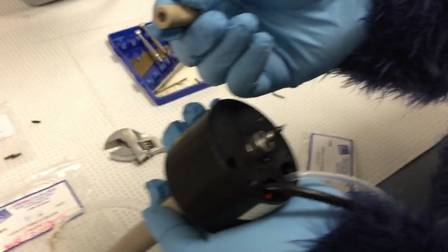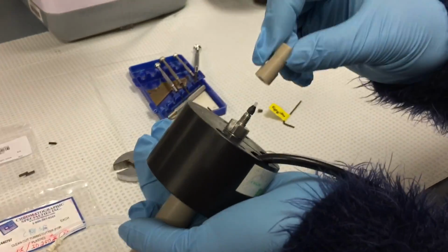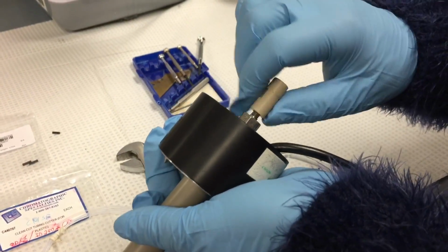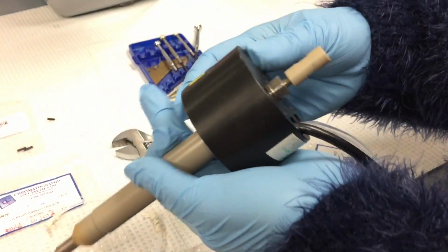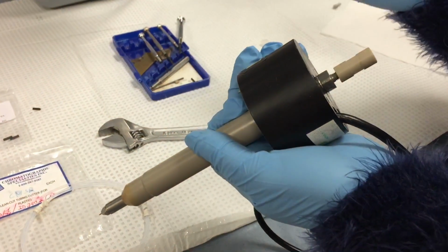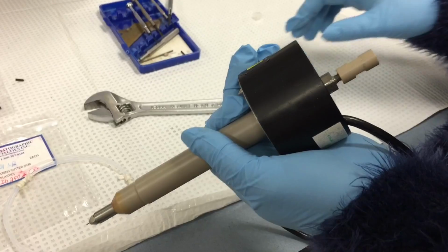Next, we want to add the PEEK union. Doesn't matter which end gets screwed on. Just want it finger tight. Don't want to over tighten, because that will break the graphite ferrule, which we don't want to happen.